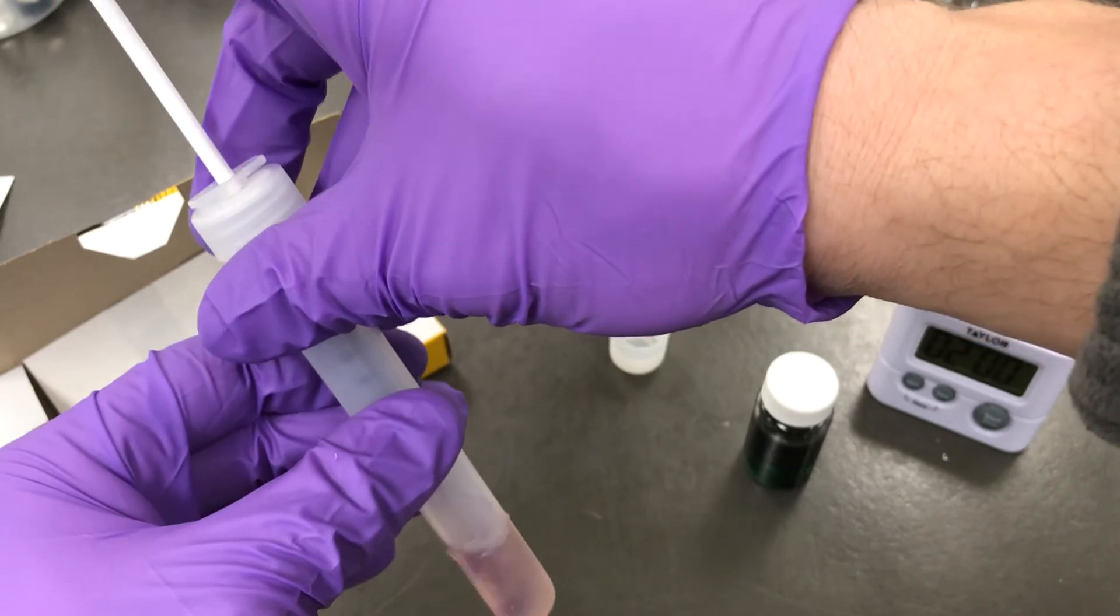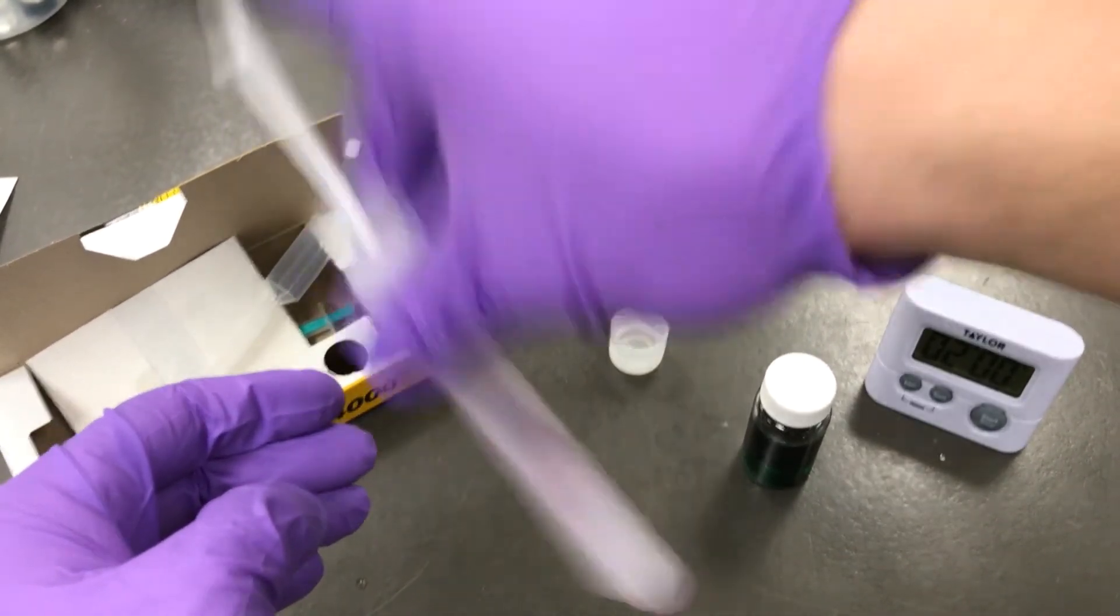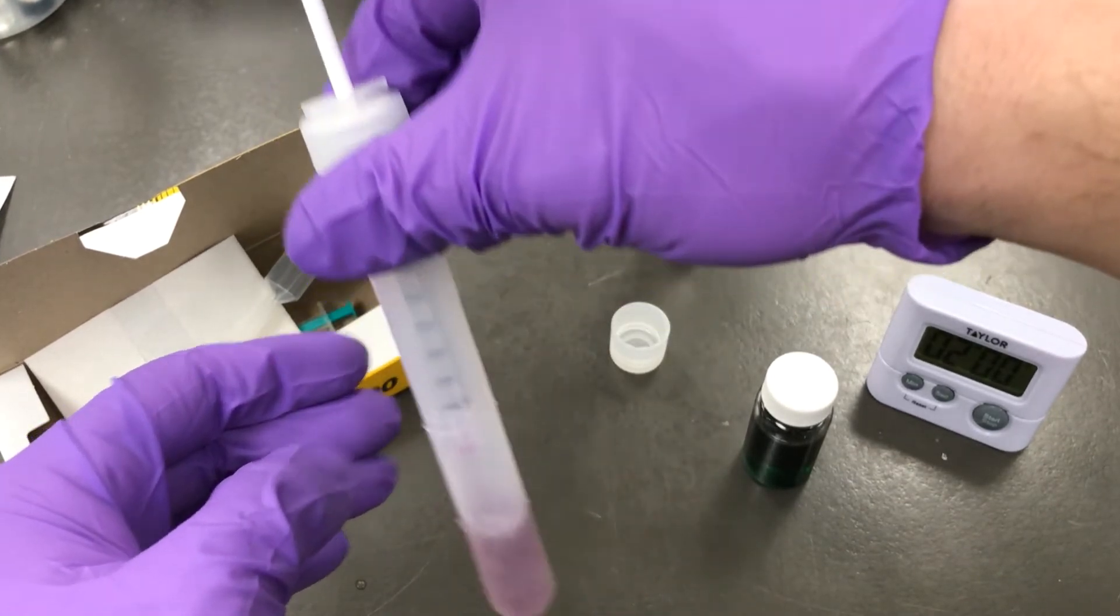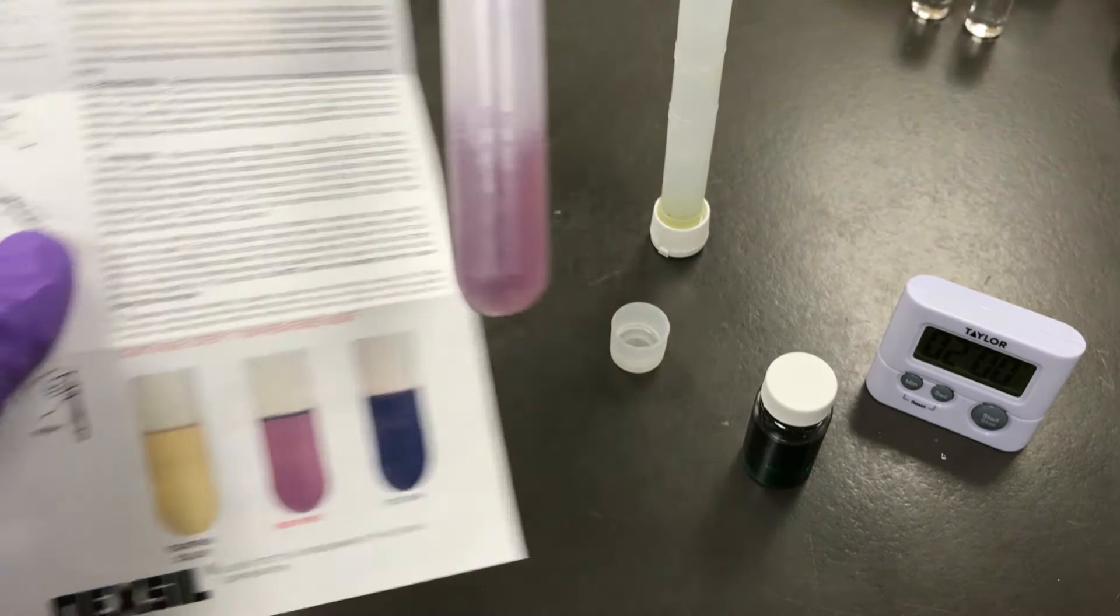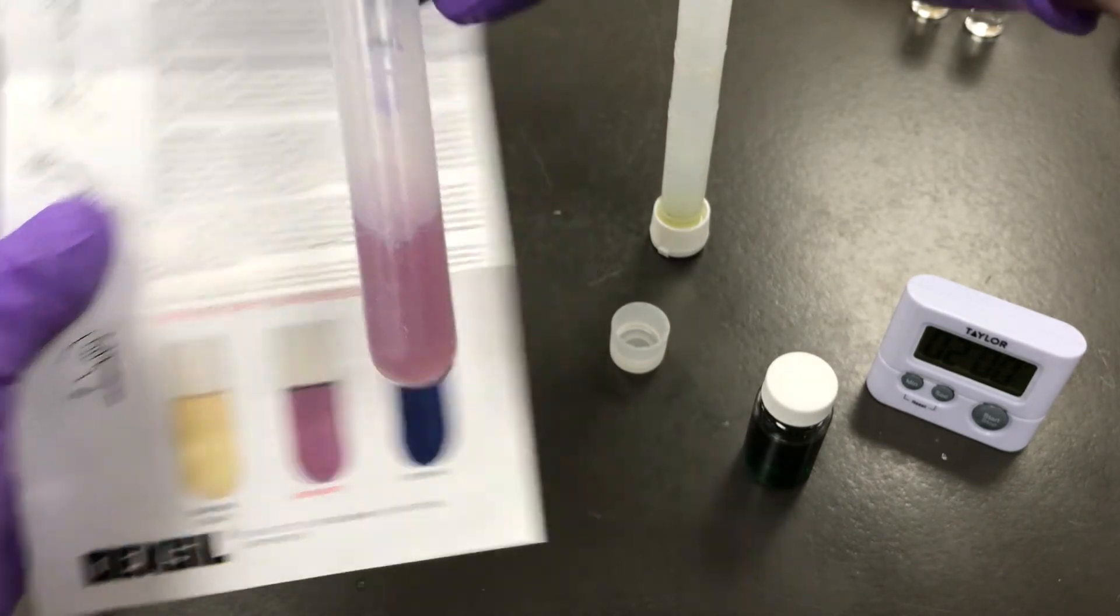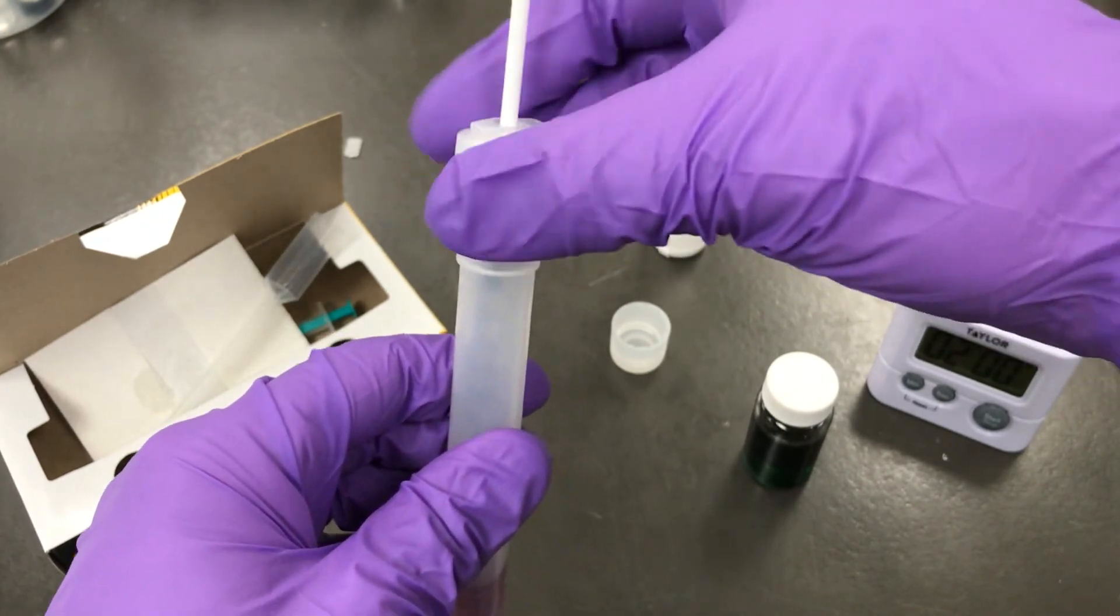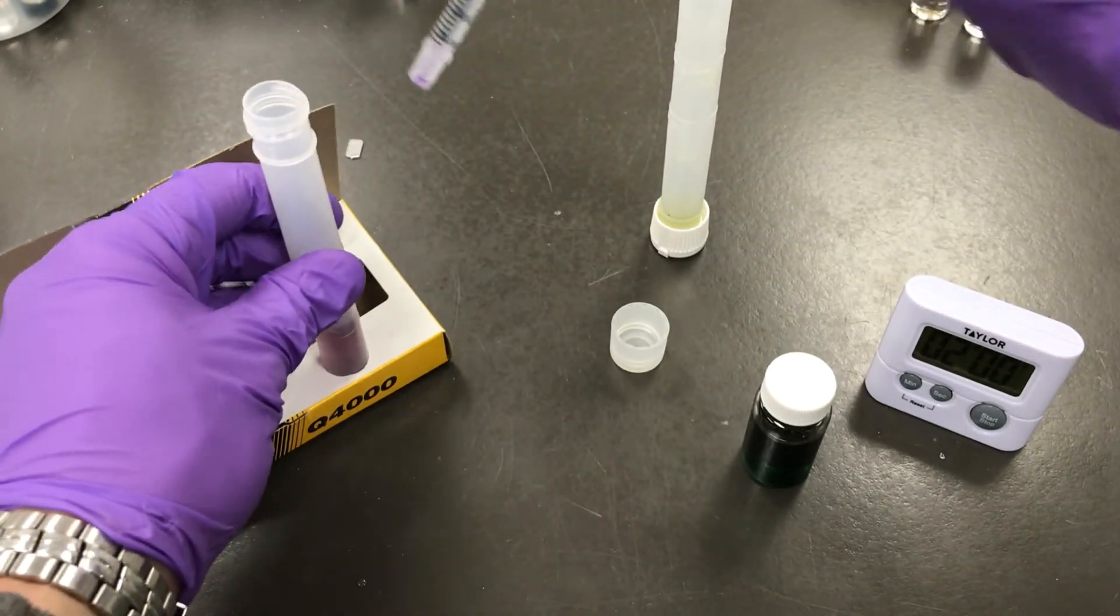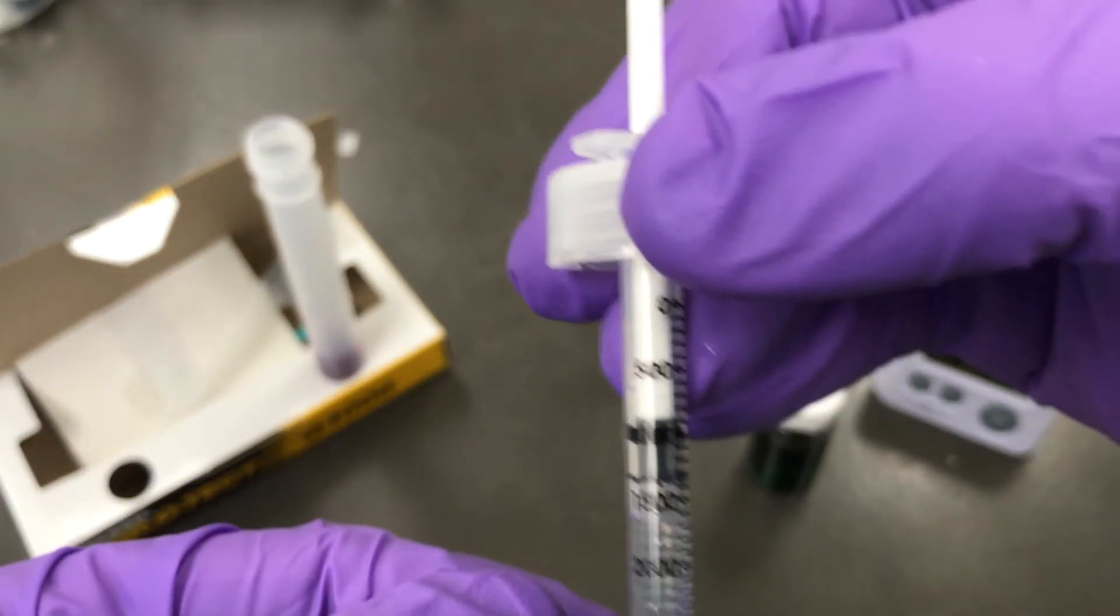So right now we're at the pre-end point. One more drop should do it. There we go. Perfect.